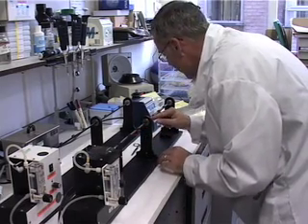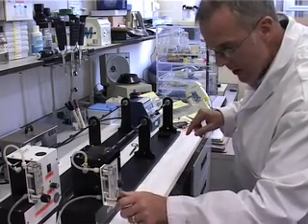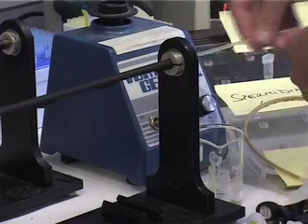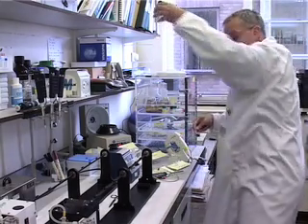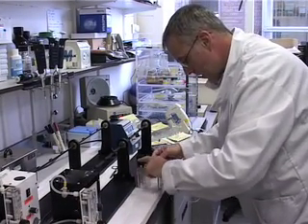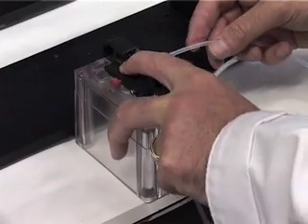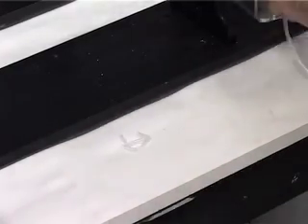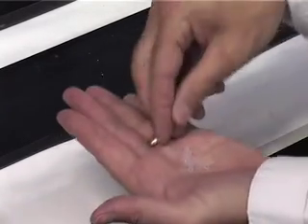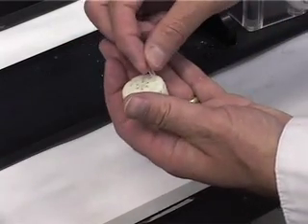If there are clumps that's a bad sign — it's referred to as agglomeration, where the ratio of DNA and gold is not correct. The tubing is removed and is cut to an exact size. Finally, here are a few desiccated gold-DNA bullets, ready to go straight into the gene gun cartridge holder, or you can store them at 4 degrees until required.